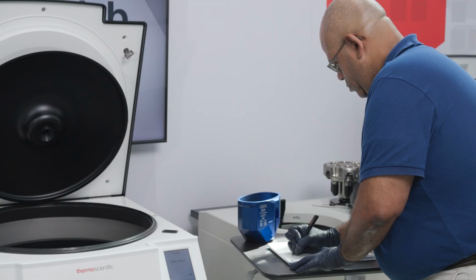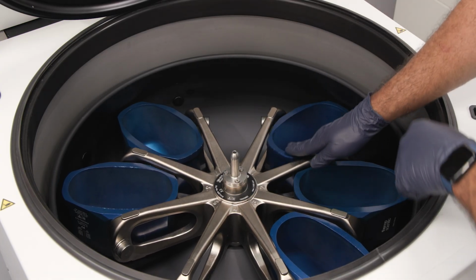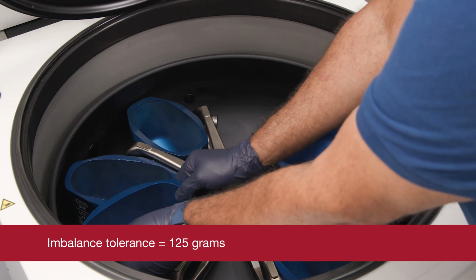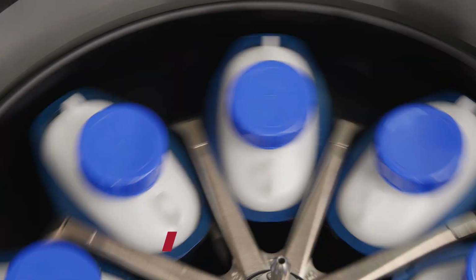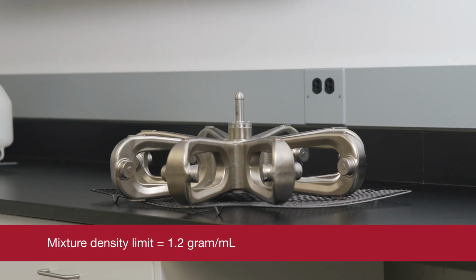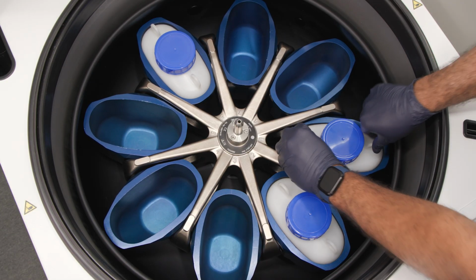Please note that while the centrifuge keeps a record of rotor cycles, the cycles for buckets, adapters, and bottles must be recorded manually in the logbook. It's important to load buckets into the rotor symmetrically to avoid imbalance, bumpy spinning, and possible damage. Adhere to the imbalance tolerance of 125 grams. Each rotor is designed to run with its maximum load at maximum speed, but the centrifuge's safety system requires that the rotor is not overloaded. Rotors can handle mixtures with densities up to 1.2 grams per milliliter. If the load exceeds this limit, you should either reduce the amount of substance or lower the speed.